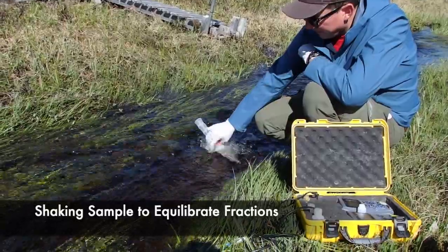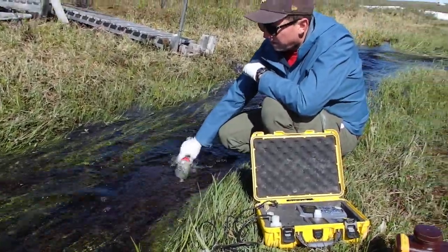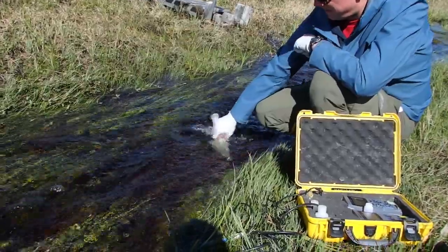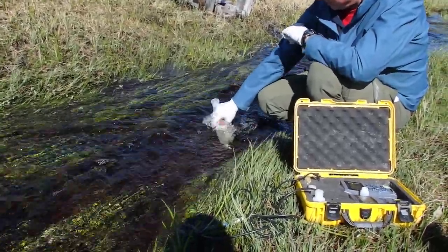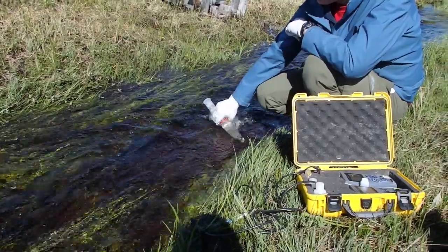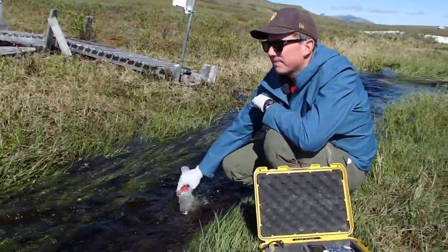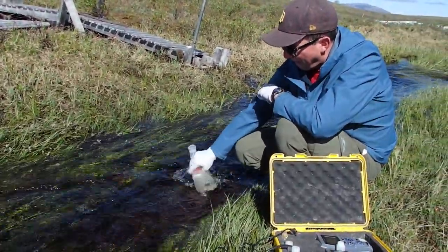He's collected his water sample and a sample of the air in the atmosphere, and he's equilibrating the two by shaking the syringe in the cold water. It's kind of like a soda bottle — you get a lot of dissolved gas, shake up the soda bottle and that gas comes out. He's trying to get the gas that was in this stream to come out into the headspace above the water sample in his syringe.